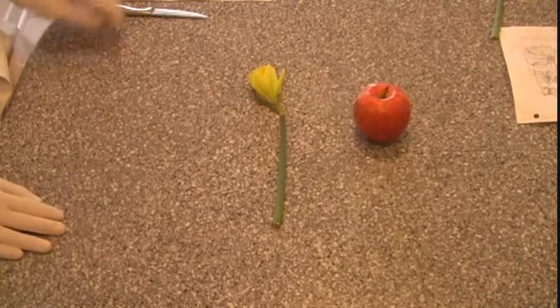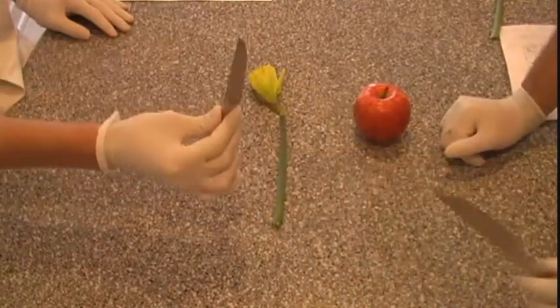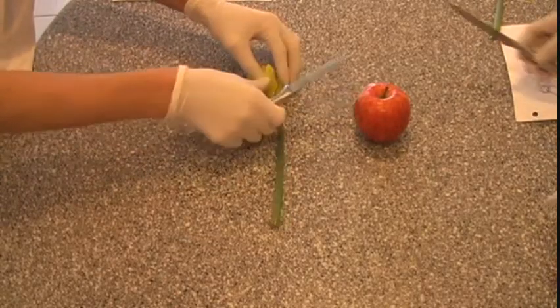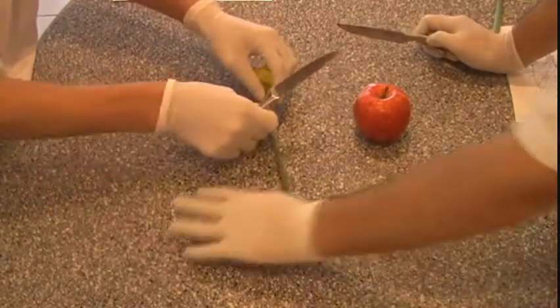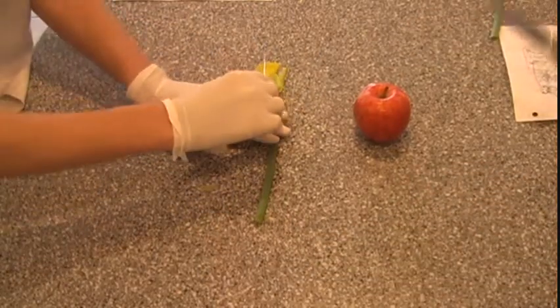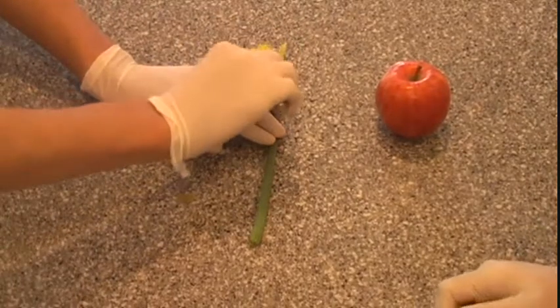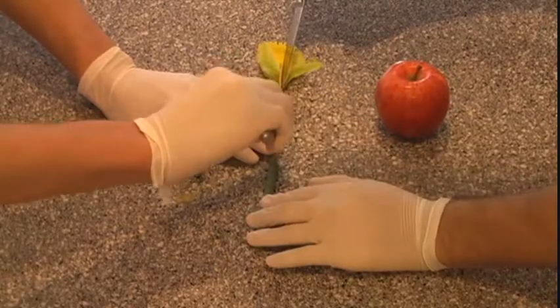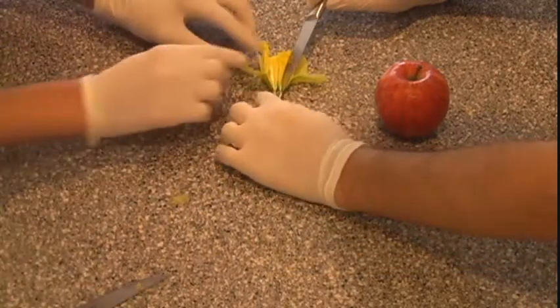It's okay — it's not a video. Doctor, let's begin the proceeding. Scalpel. Yes, check. Alright. First, we're going to perform the... we're going to get this little gross... I don't know what this is. We're going to do the lateral incision. Indeed. Zooming in so that we can get this incision a little more precisely. Excellent. This is quite a precise incision.